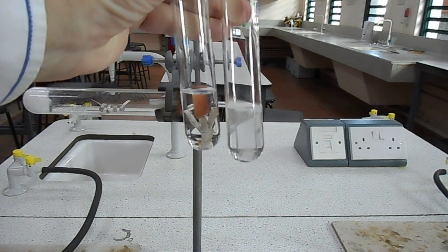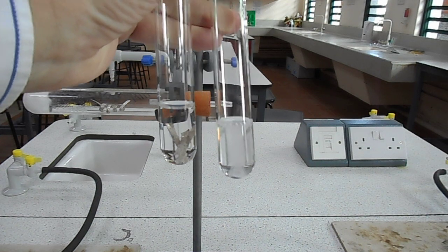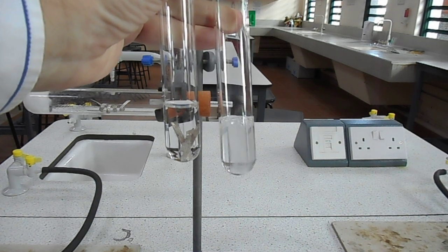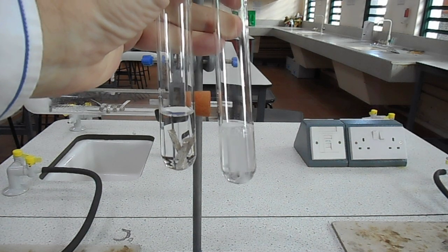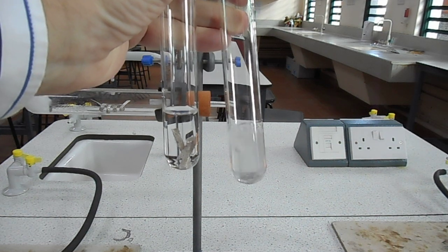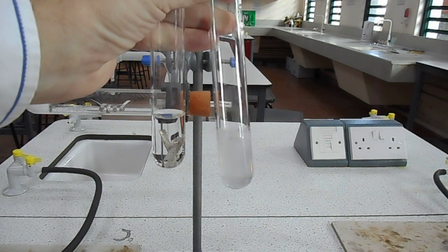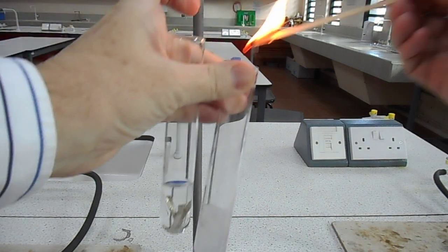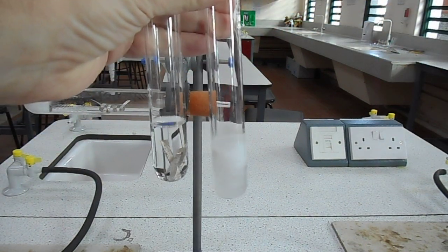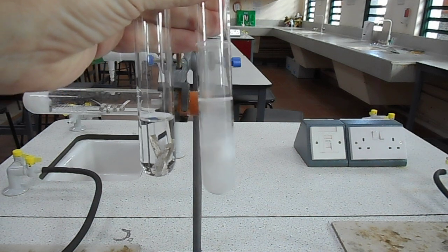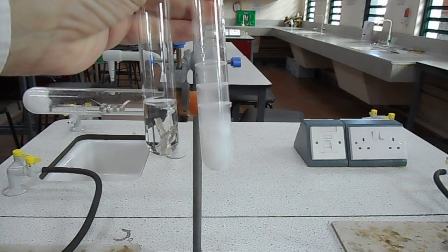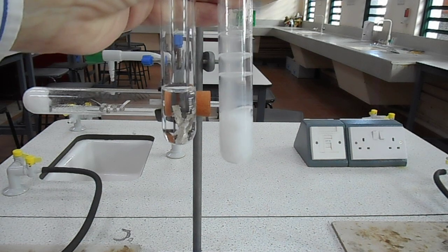You should be able to see bubbles of gas being produced, which I may be able to trap slightly with my finger there. The seal is not perfect. Then hydrogen. And the calcium reaction is quite vigorous.